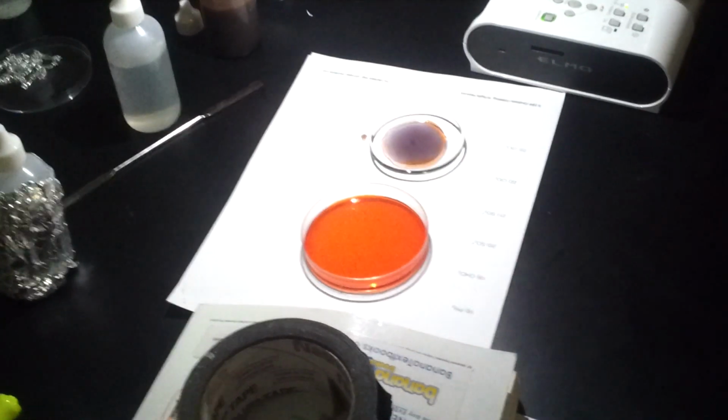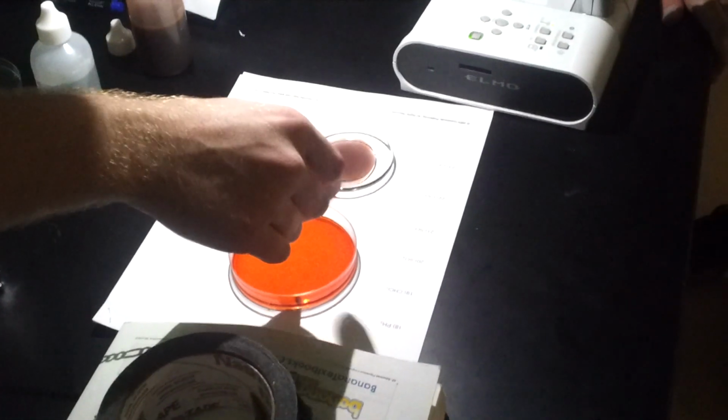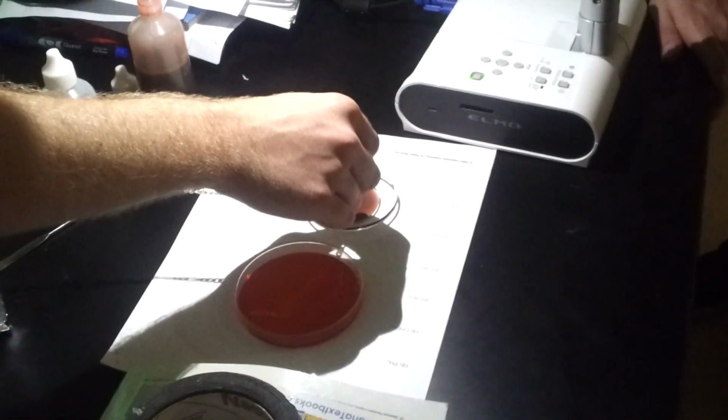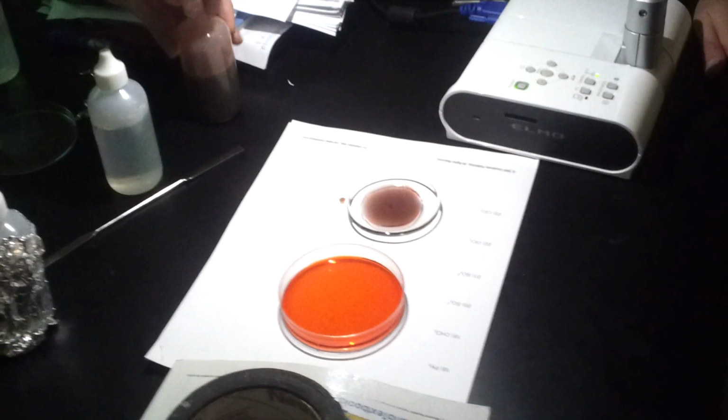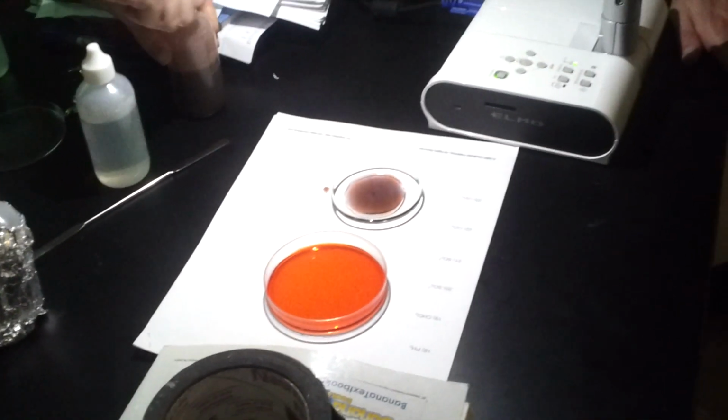You want to use the silver? Yes, I just have to get it. Let's see if this will do anything. I never used the silver before to try to get this to work. Usually you wait till it changes color once before you start playing with it, but this one on the right isn't changing. I'm pretty sure I've added everything. You guys see me skip anything there? I added everything to both, right? I don't know what's going on with the right. That's why I did 2, just to be safe.